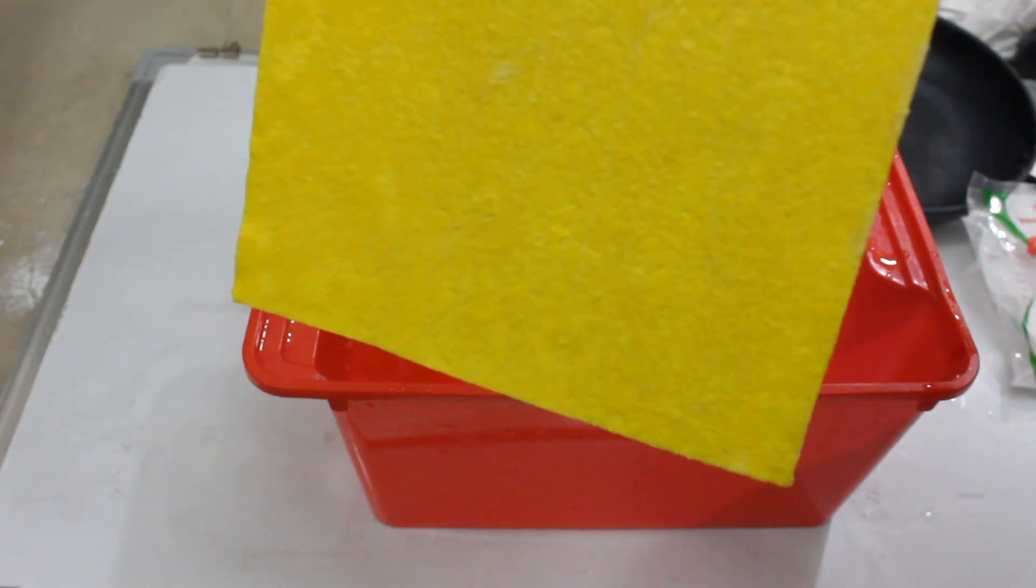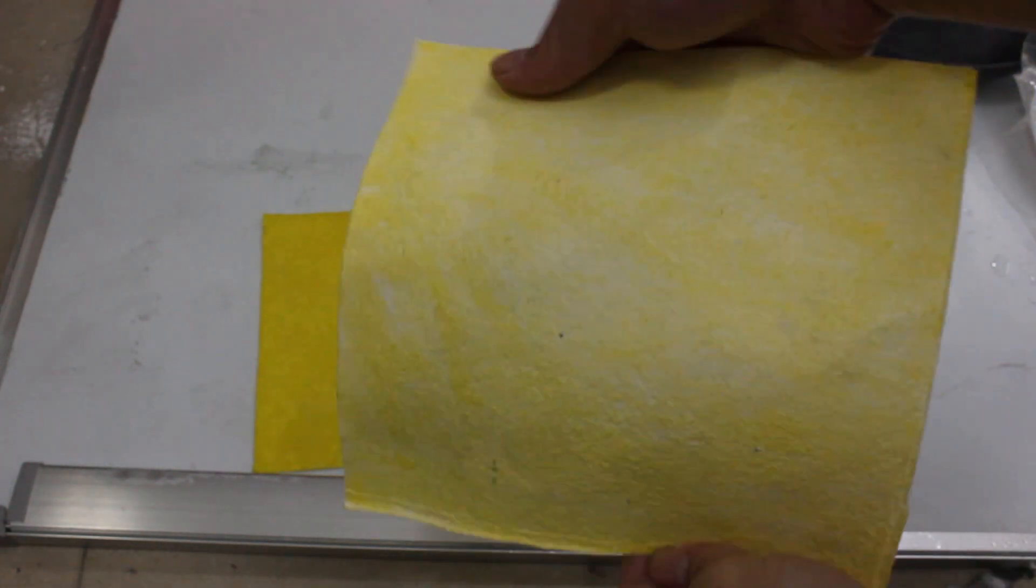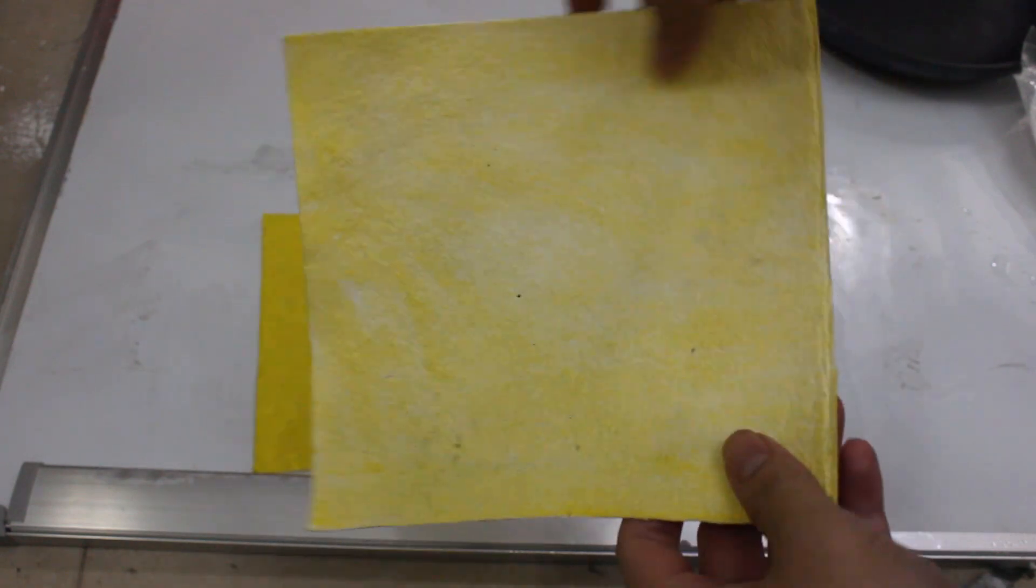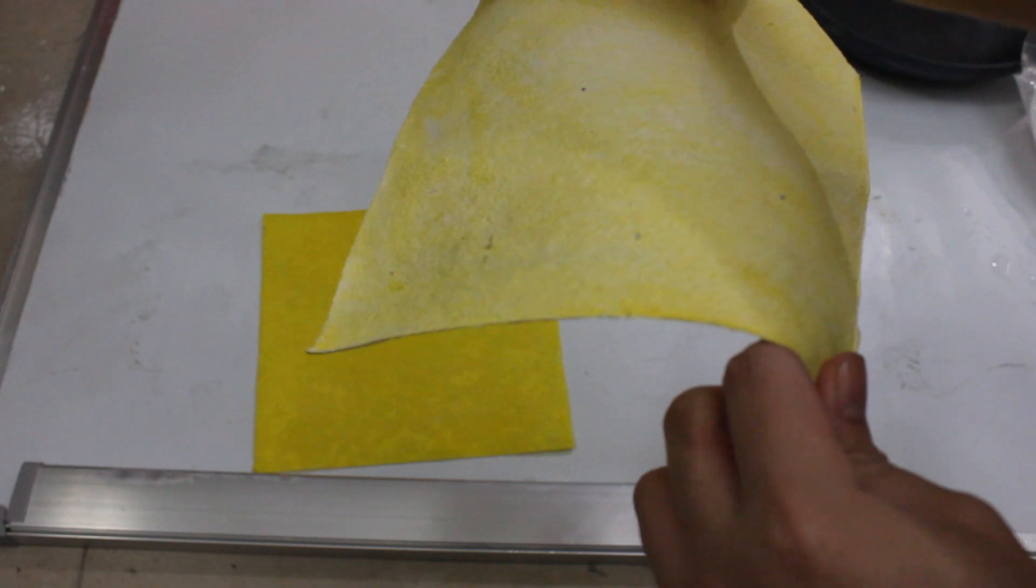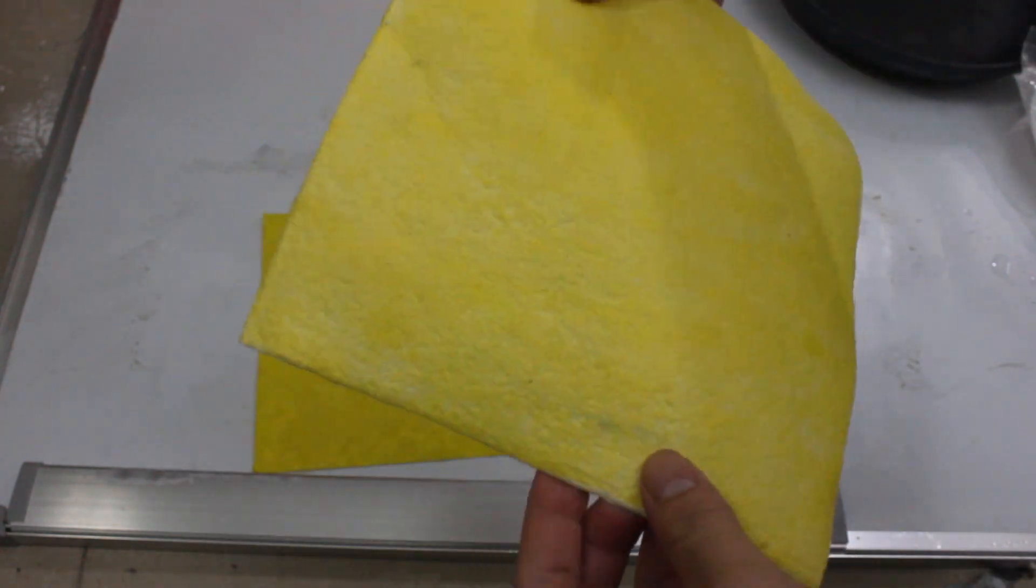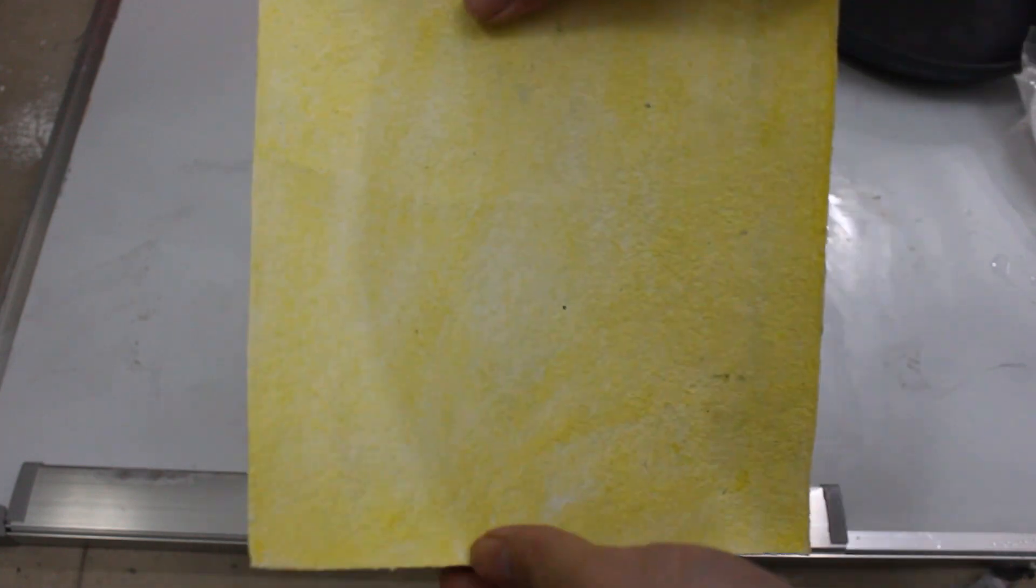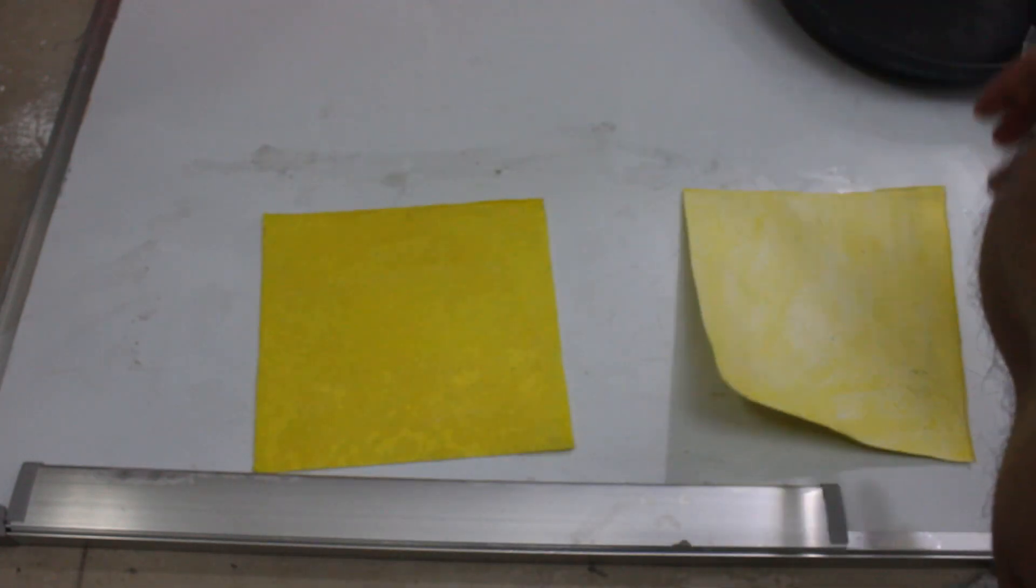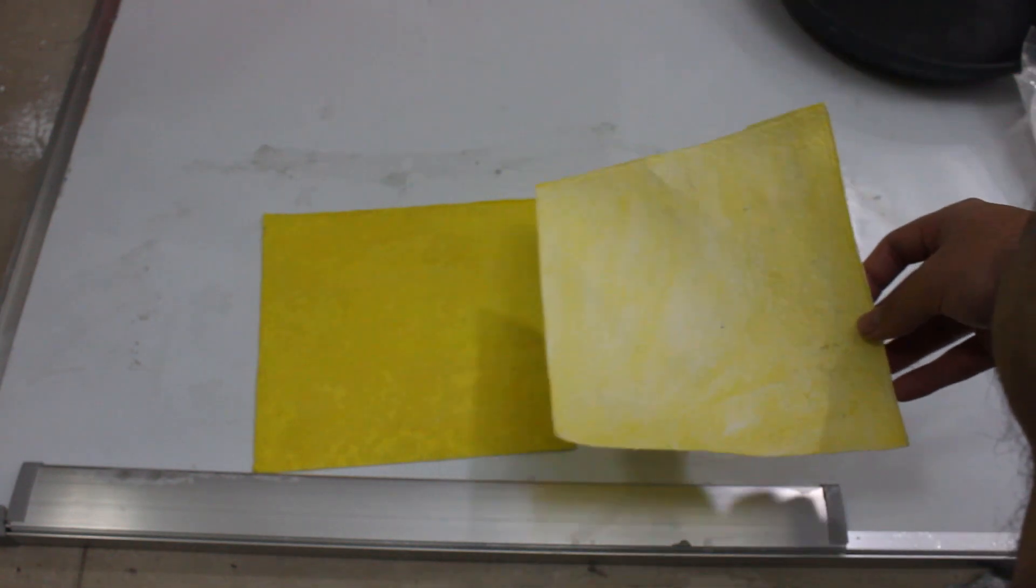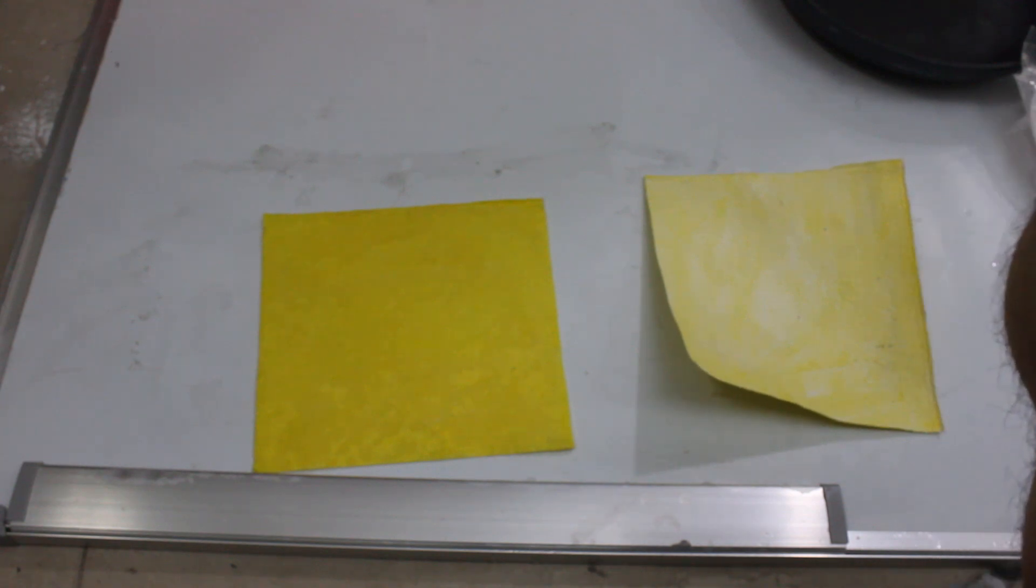So here's an example of one that I made previously. It's more dry, although it kind of curved because I kind of left it in an uneven place, because I mean I used the other half to make my current sulfuric acid cell. But when it dries out, it really changes color to this whitish, and it does also curl up but only after a certain amount of dryness. To reset this, all you need to do is just to wet it a little.